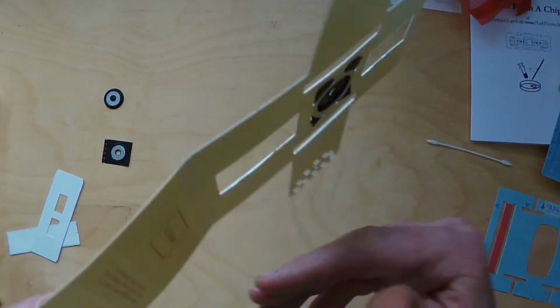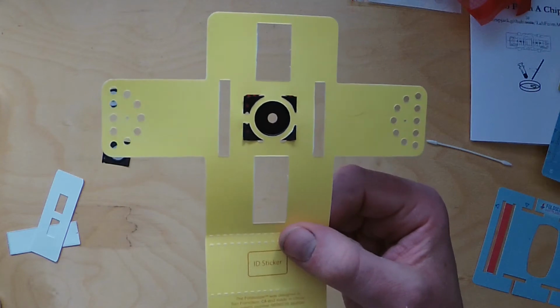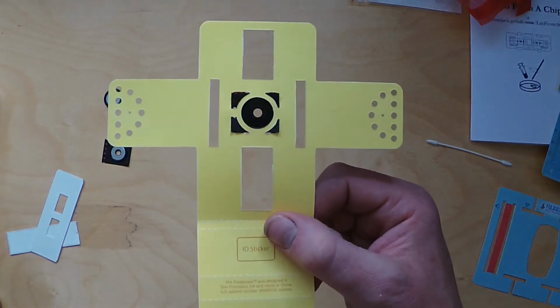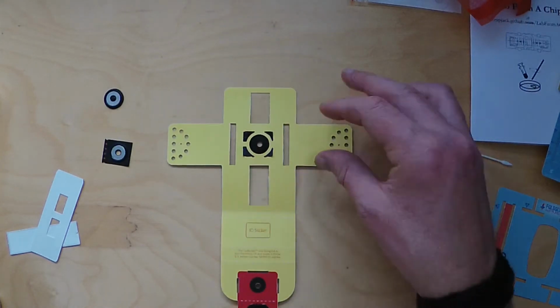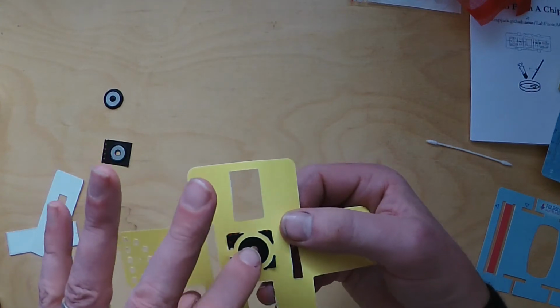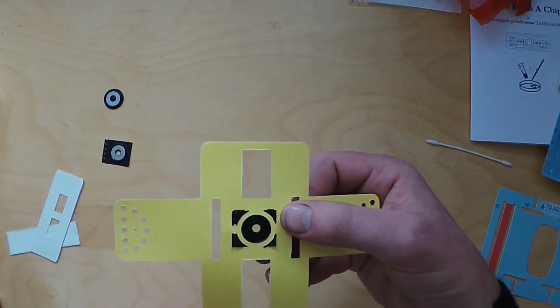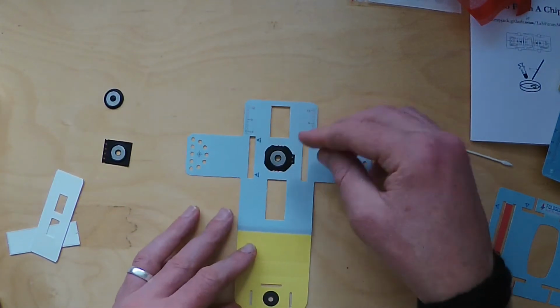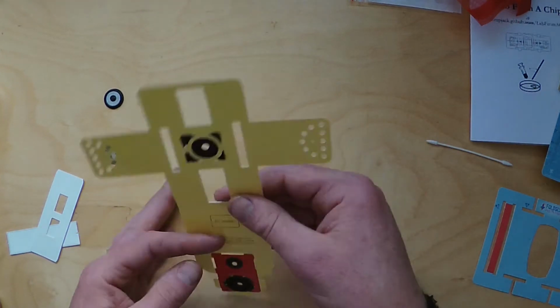Just wiggle it around a little, and what you'll end up with. Oh yeah, and important to note that you want the silver side down. So what you end up with is something like that. So both couplers have the black side up, silver side down. If we turn over, you now see they both have the silver sides up.